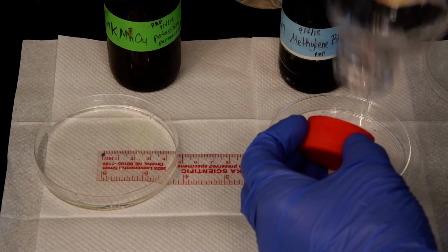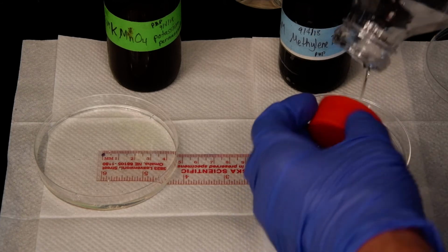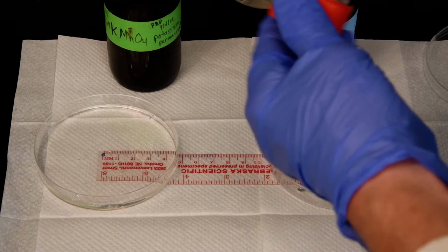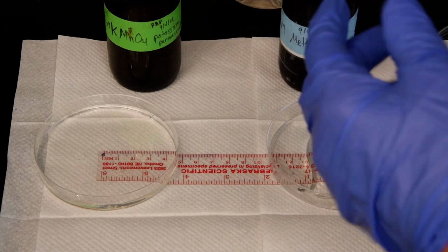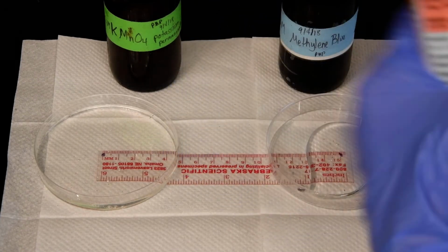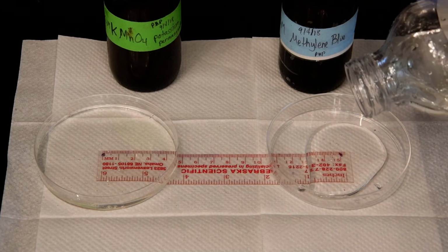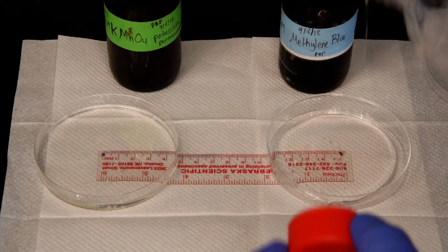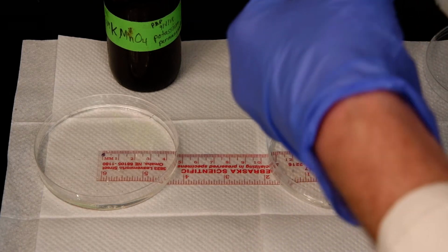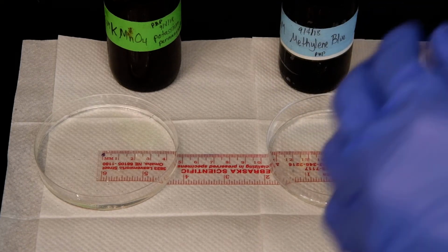We couldn't use the dark corn syrup like we used for our cell experiment. We're going to cap that off, put that over the side, and get another bottle here to make these the same volume-wise. Here we're just using this as a medium that the molecules will move in, and we wanted to slow the molecules down a little bit.